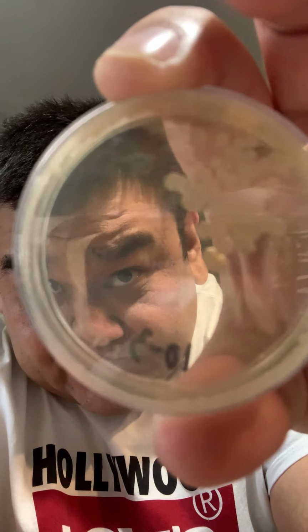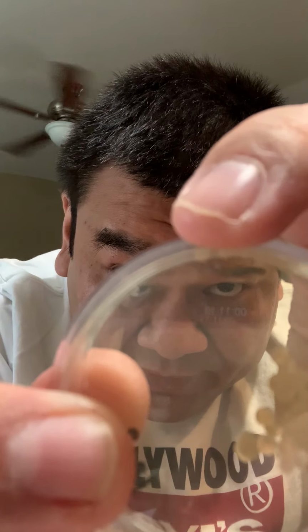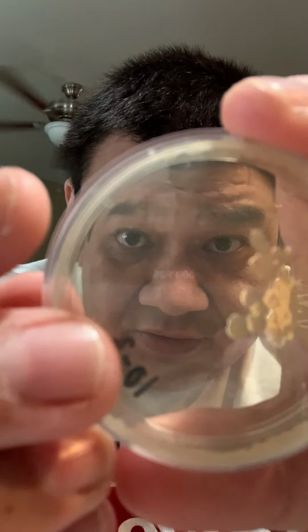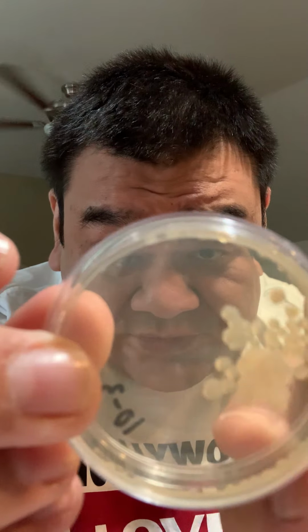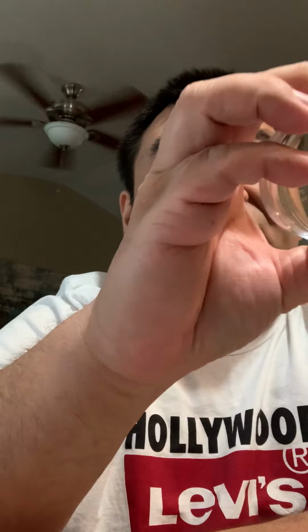And that's what I was talking about. There's more here, from here all the way to here, basically where my finger is, all the way to this part, you see a lot of them on the edge, but from here to here, it's practically empty. So that's why I was questioning my measurement, whether it was even or not.